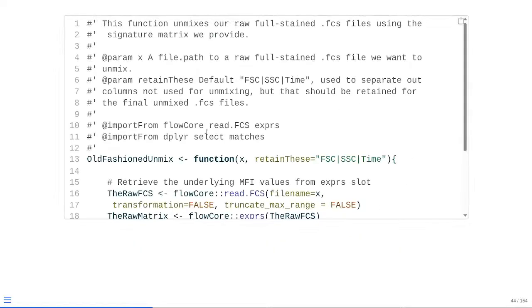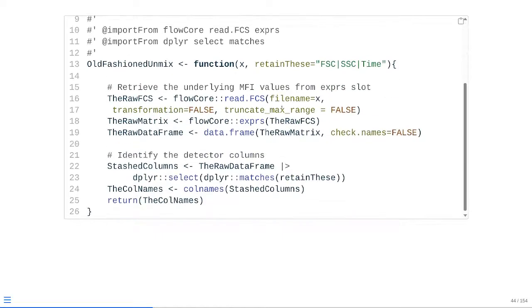So what does this look like? As you can see, the new argument is designated by the @param in the Roxygen skeleton, with a new @importFrom handling those dplyr dependencies. And because we're building out the code inside the function, I'm starting to add a few comments just to let us know what each of these little chunks of the function are actually trying to do. So in this case, this comment is basically telling us we're trying to identify the detector columns, which will make it much easier when you're trying to reread what the function's doing later on in the future.